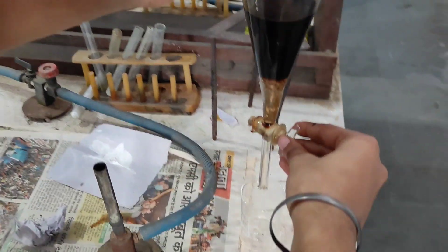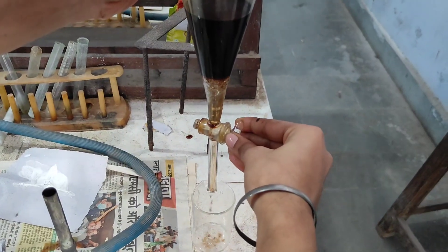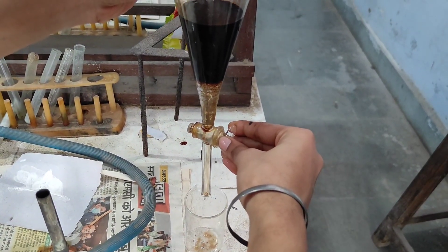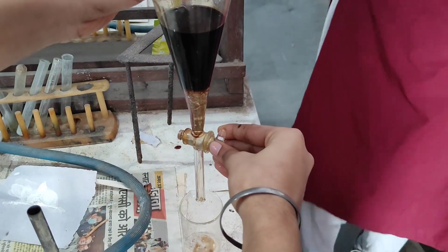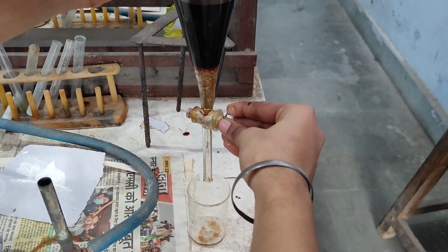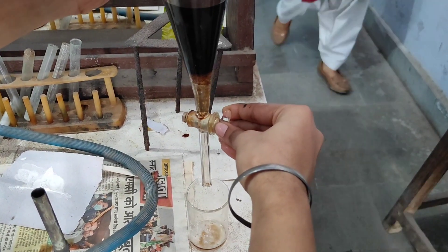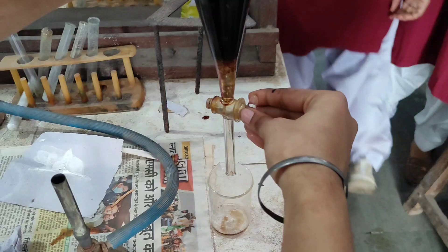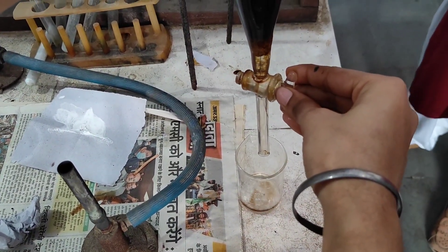After settling, we can see the layers have separated. The lower layer contains the caffeine. We easily separate the transparent lower layer by opening the nozzle of the separating funnel and draining it out little by little.